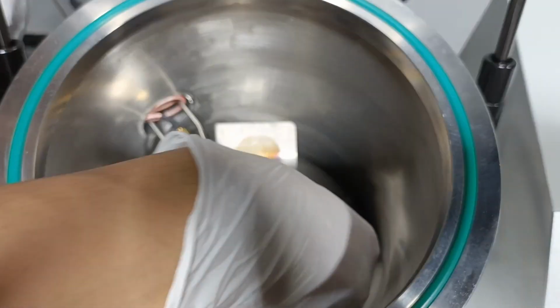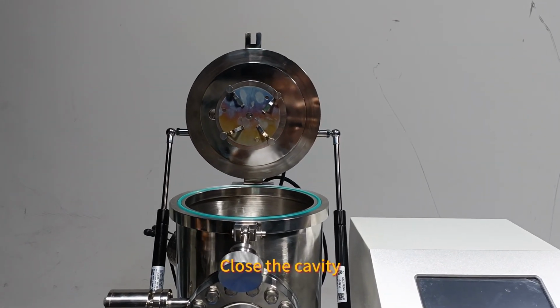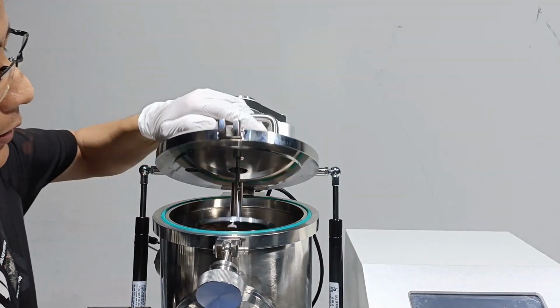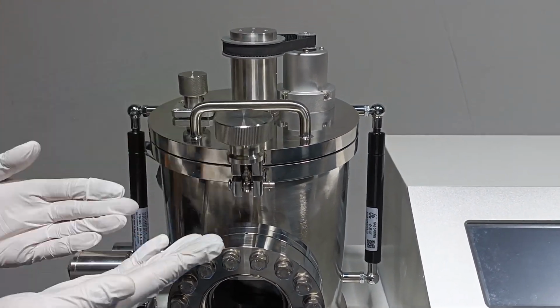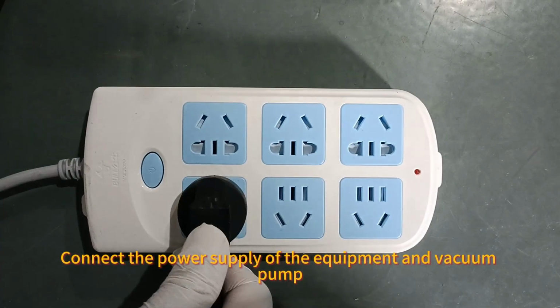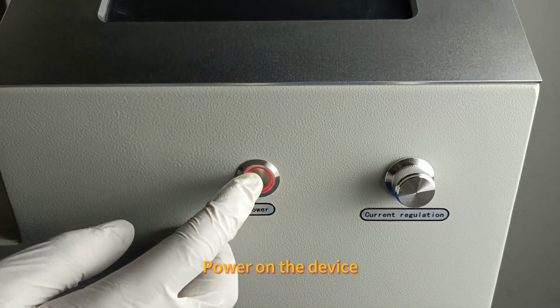Insert the cover. Close the cavity. Tighten the buckle. Connect the power supply of the equipment and vacuum pump. Power on the device.